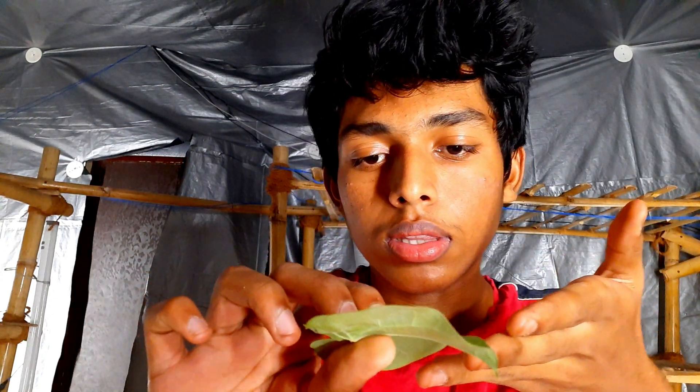The cells that make up the leaf are actually parenchymal. There's a need for preparing a slide as well as some stains, so let's just view this down the microscope.